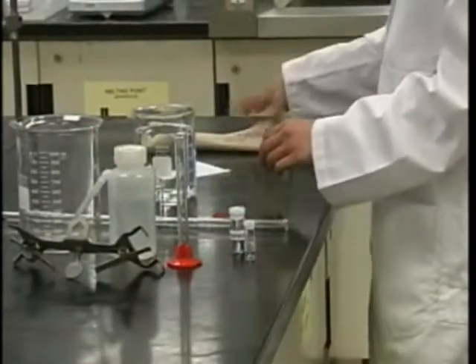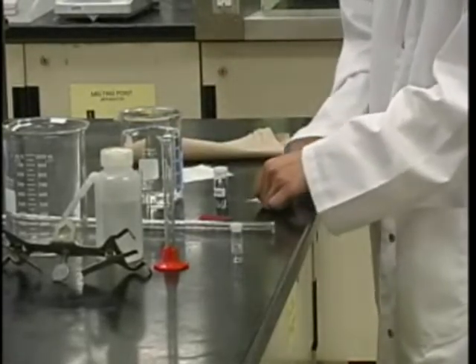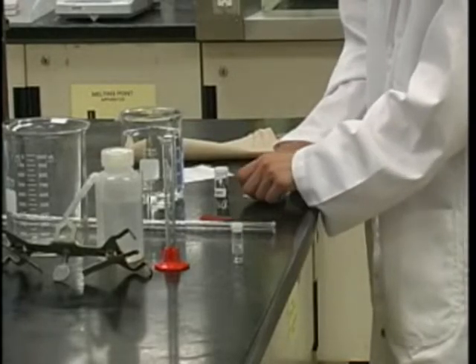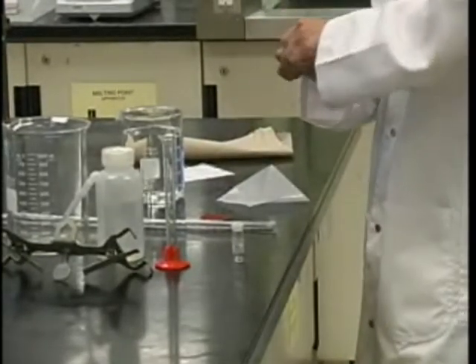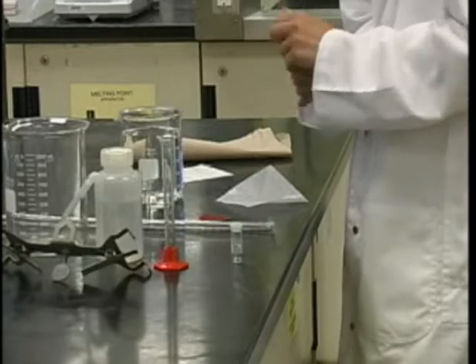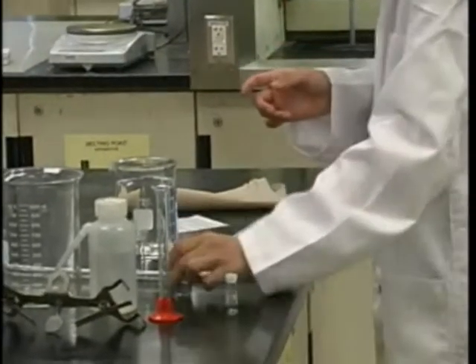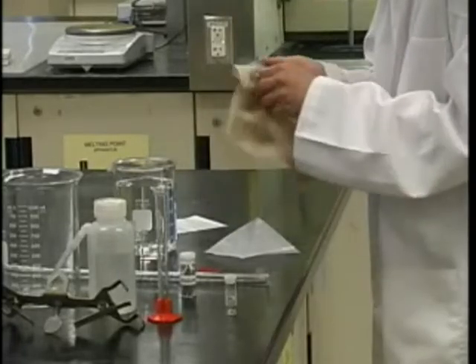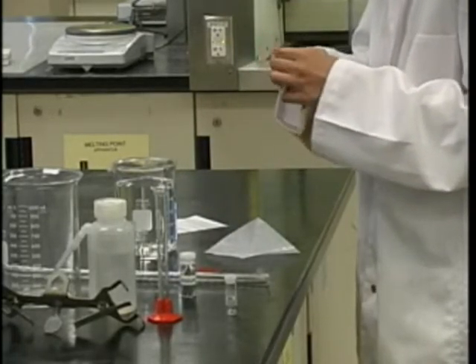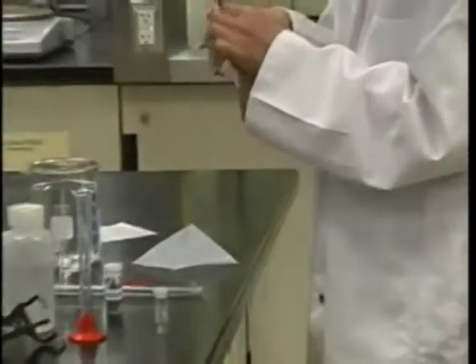To begin this experiment, take a piece of weighing paper and crease it in half diagonally. Open it and crease it the opposite way again. The metal samples have been pre-weighed already to be within the right weight range. Obtain one strip of the pure metal and close the vial. You may use the sandpaper to gently clean the metal sample. Try to hold it using a piece of brown paper so as to avoid getting any fingerprints or grease on the sample once you have used the sandpaper to clean it.